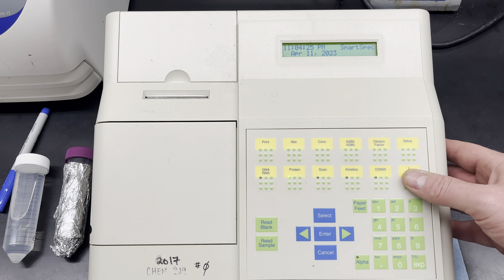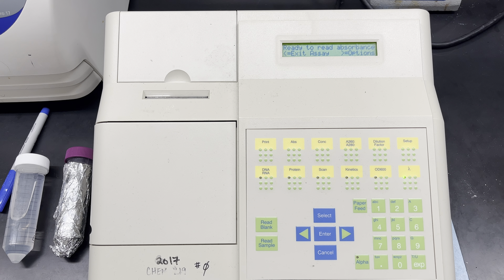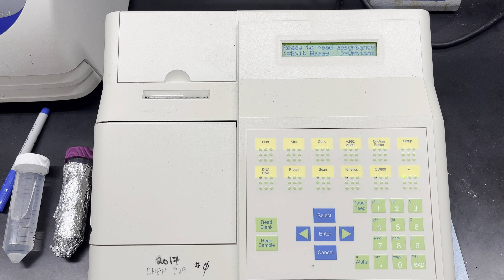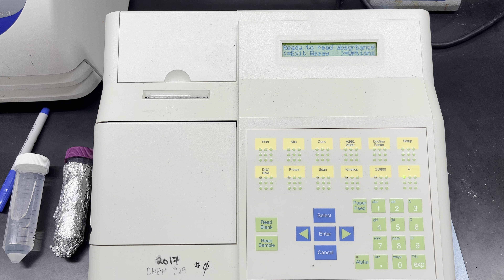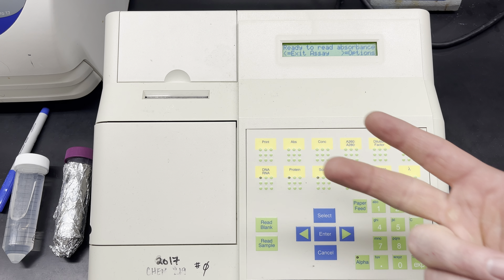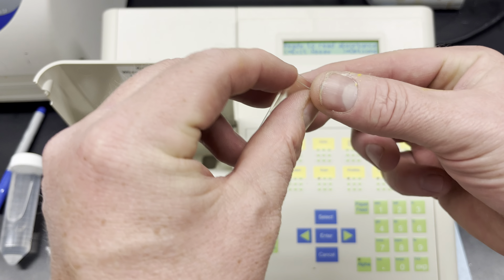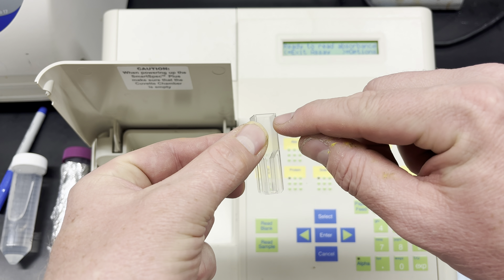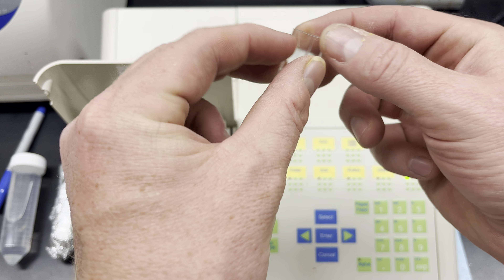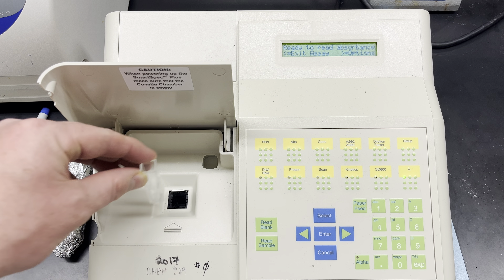Do I want to subtract a background reading? No I do not. I'm ready to read my absorbance. At this point I have in a UV cuvette my buffer, my sodium lactate, and my NAD+. I'm going to put this cuvette in where the arrow here is matched up with the arrow on the instrument.